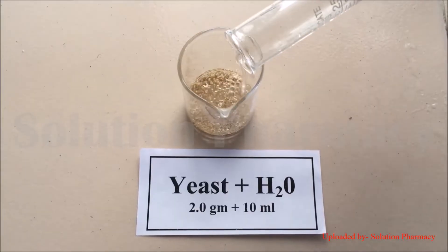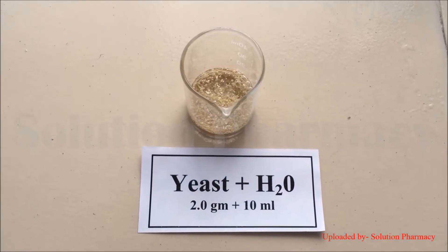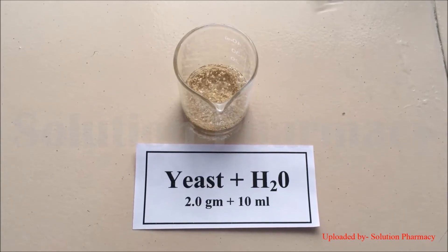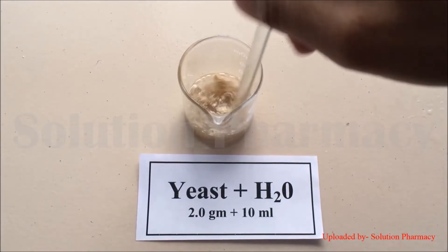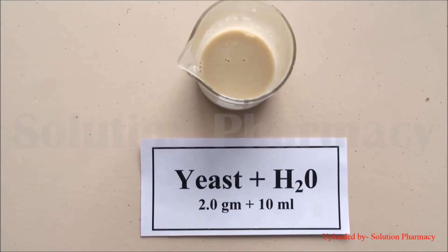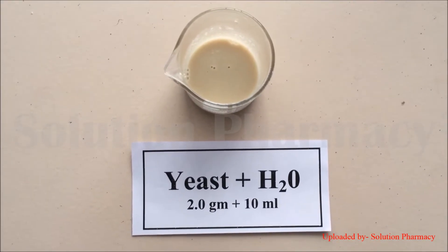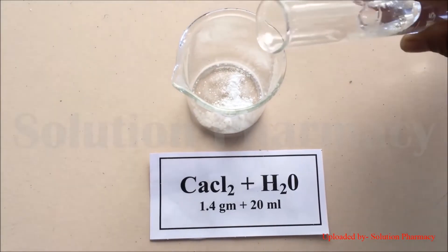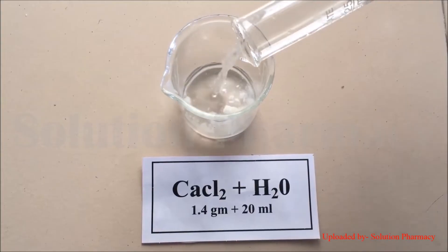Then in another beaker, add the 2 grams of yeast and add 10 ml of distilled water measured in a measuring cylinder. Generally, to dissolve the yeast we use lukewarm water to completely dissolve it. After dissolving yeast in distilled water, our yeast solution is ready.